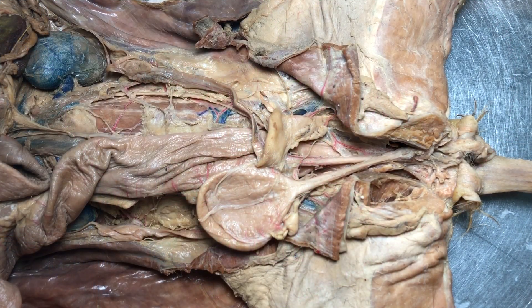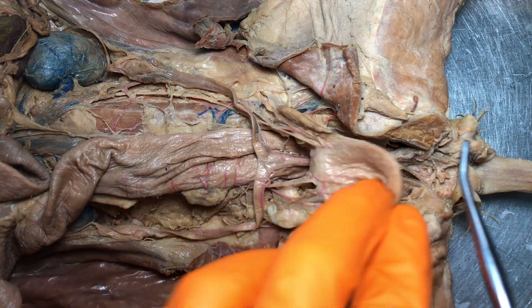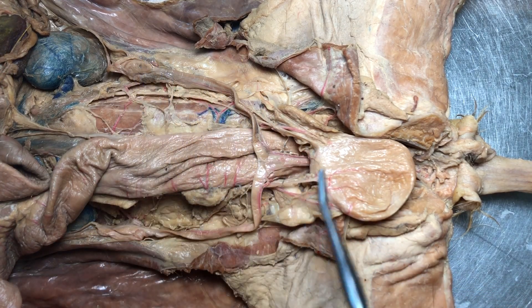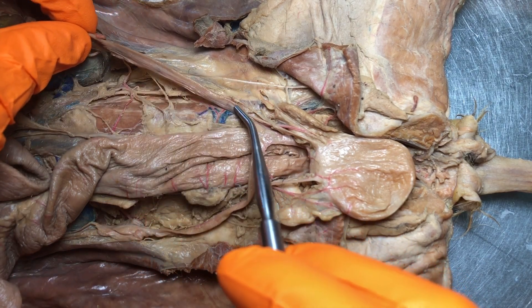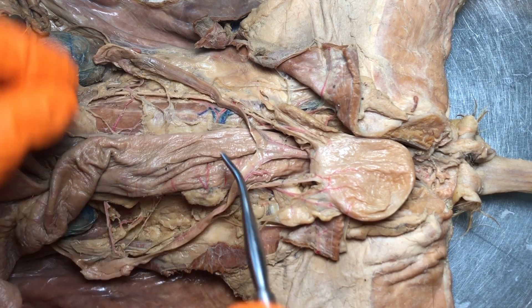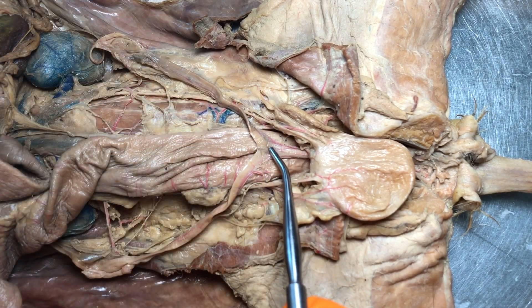Let's start with the big-picture structures of the female reproductive system on our cat. Remember that a cat's uterus is shaped like a slingshot. On a female human it looks like an upside-down pear, but here we actually have these tubes called uterine horns. This right here would be the right uterine horn, this is the left uterine horn, and where they meet up is the uterine body.